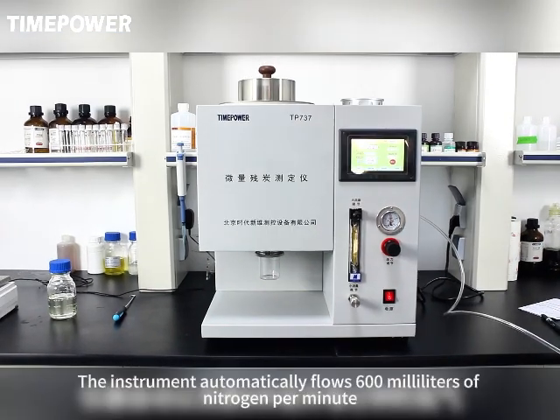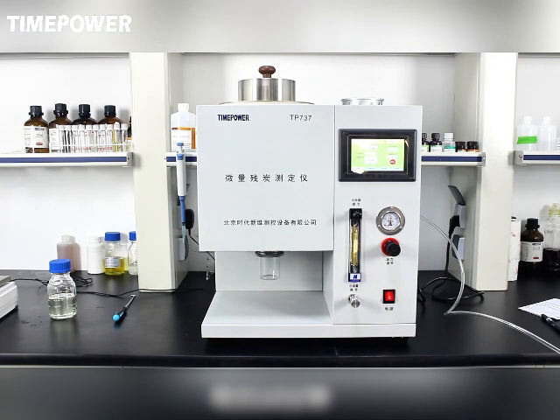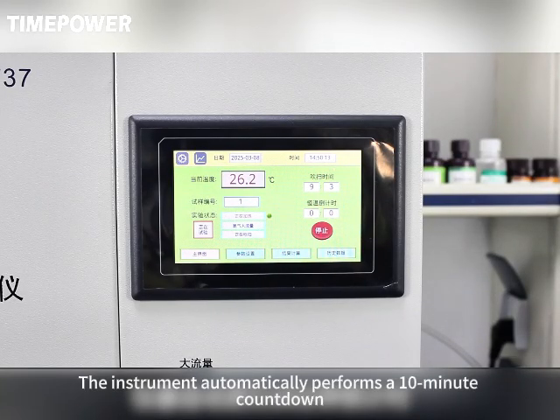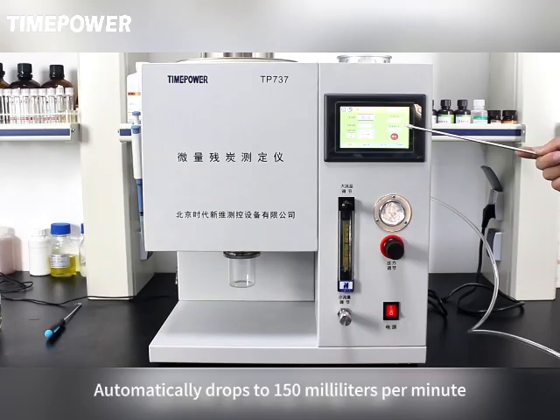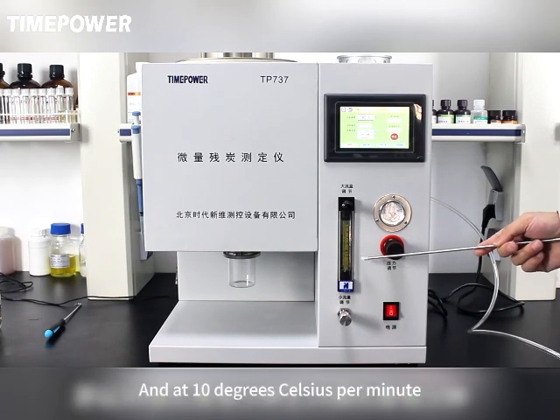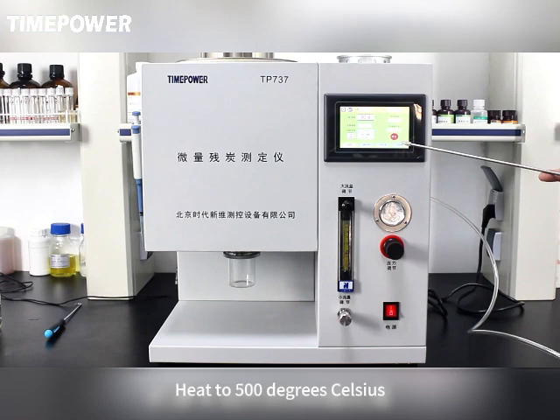The instrument automatically flows nitrogen at 600 milliliters per minute. Purge for 10 minutes; the instrument automatically performs a 10-minute countdown. After 10 minutes of purging, the flow automatically drops to 150 milliliters per minute, and heating proceeds at 10 to 15 degrees Celsius per minute up to 500 degrees Celsius.